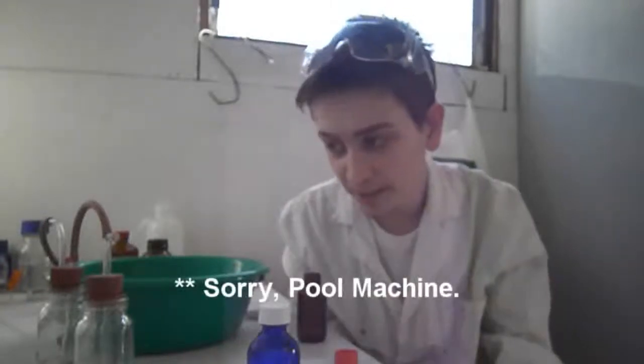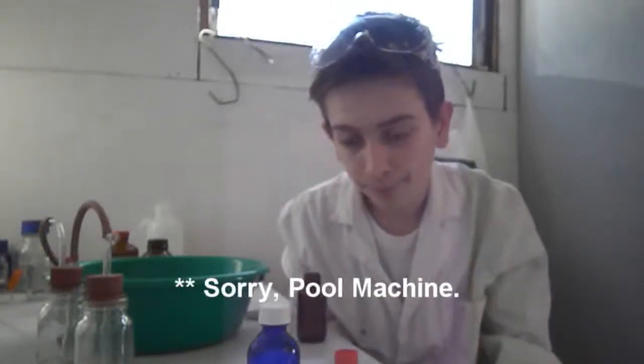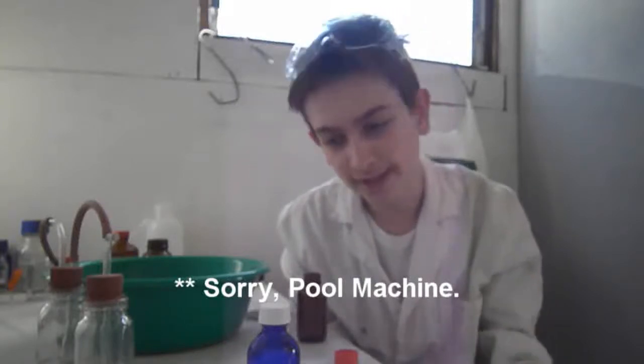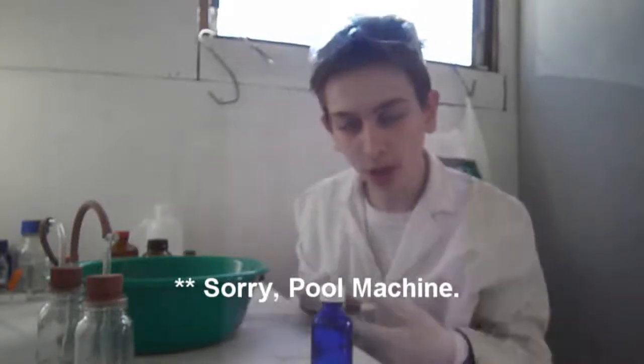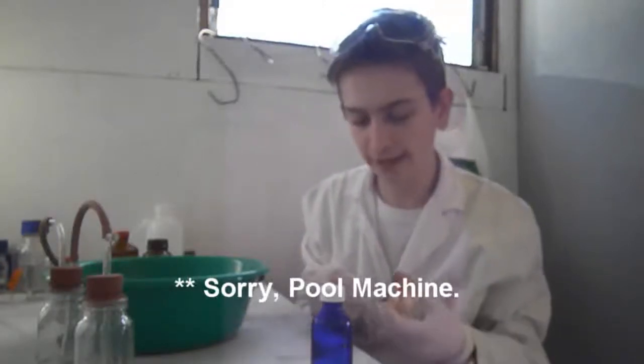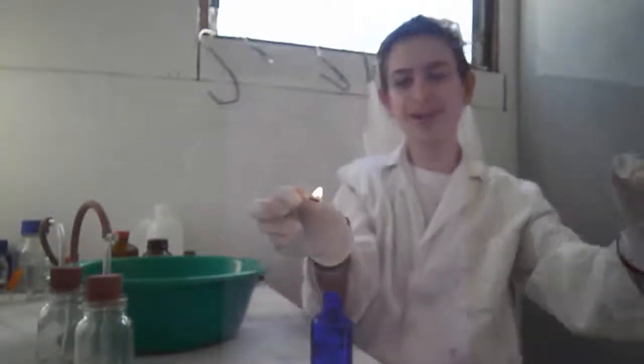I'll be doing this experiment again, with more accuracy and safety and stuff like that. Next time, I'll show you how you get zinc, carbon, graphite and manganese dioxide from a battery. Alright, ready for this? Alright, that was pretty cool. That was a nice little one.